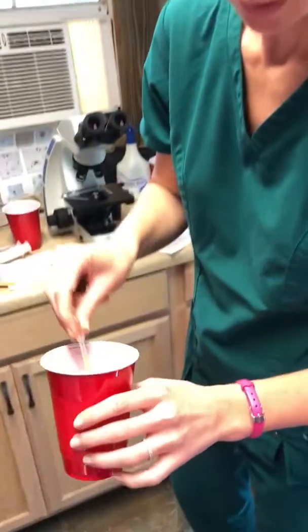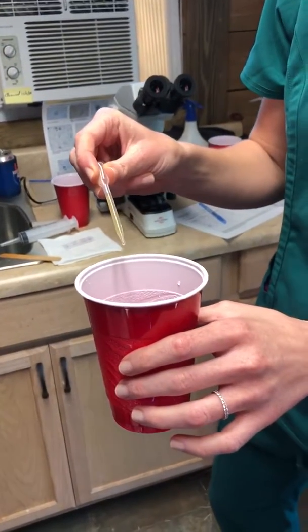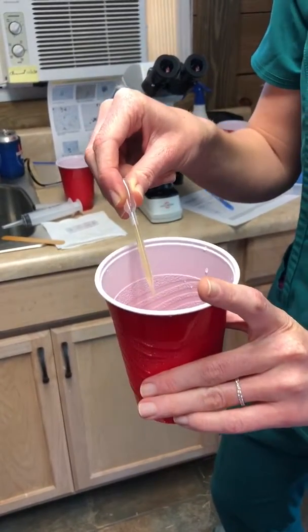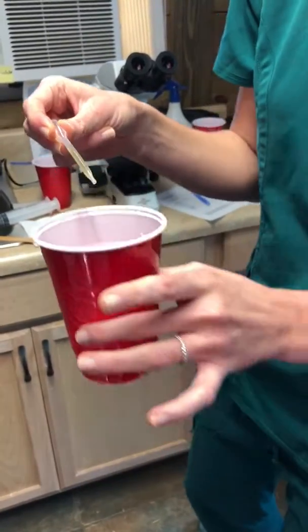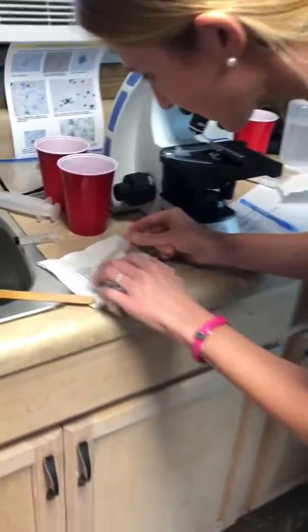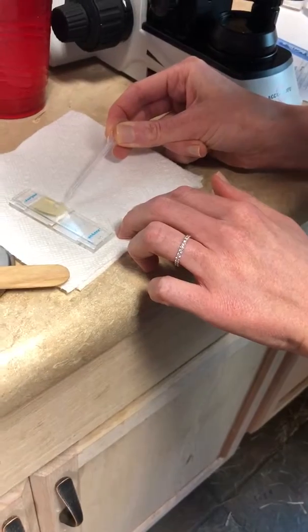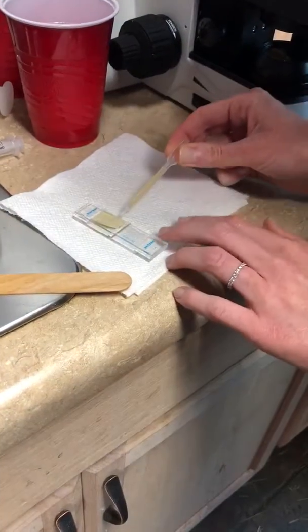With a little dropper, take out some of that fluid. I use the same dropper so I make sure it doesn't get into the bulb, because it's easy to clean as long as it's in the stick part — but once it gets to the circular bulb it's a little bit harder. That's just a nitpicky thing I do for myself. You kind of just squirt this into each side of the chamber until it fills up — one or two of those will fill it.